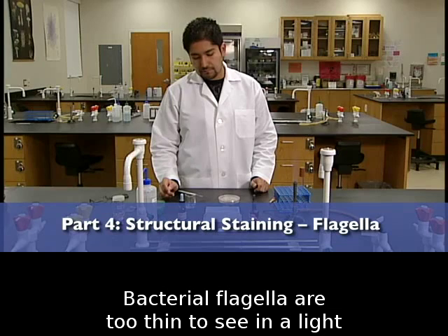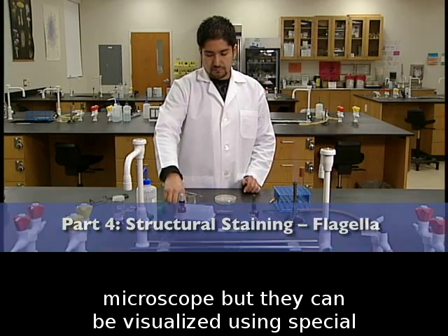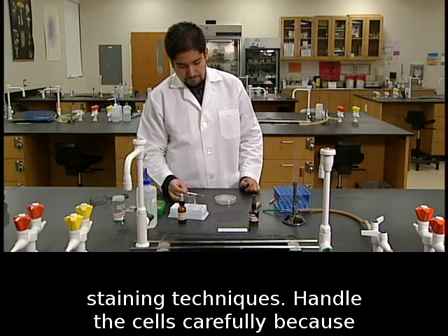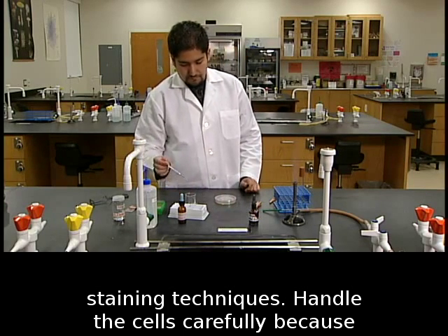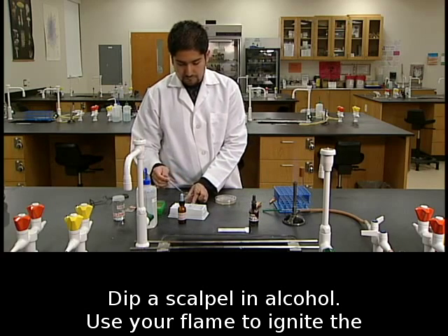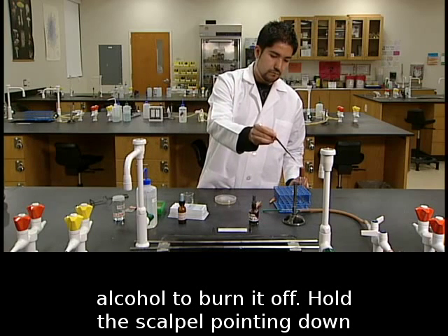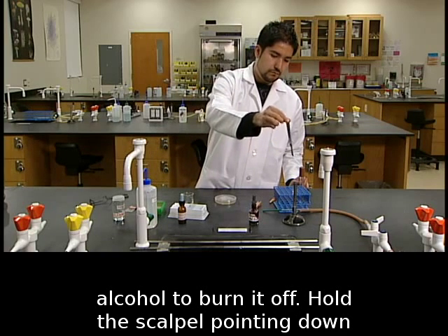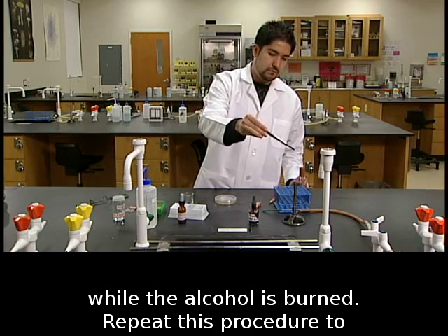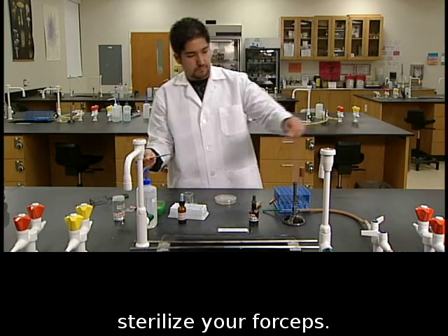Bacterial flagella are too thin to see in a light microscope, but they can be visualized using special staining techniques. Handle the cells carefully, because flagella are easily broken off of the cells. Dip a scalpel in alcohol. Use your flame to ignite the alcohol to burn it off. Hold the scalpel pointing down while the alcohol is burned. Repeat this procedure to sterilize your forceps.